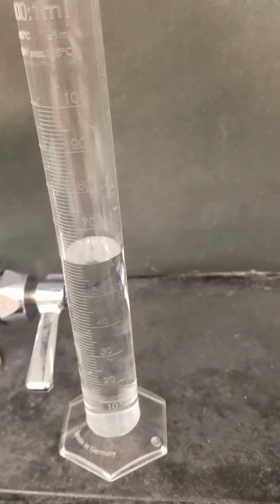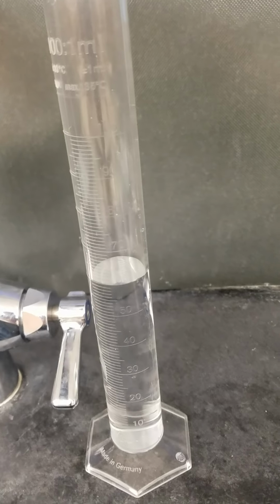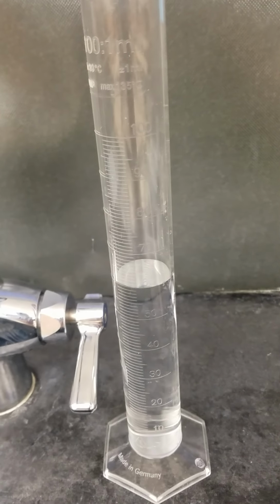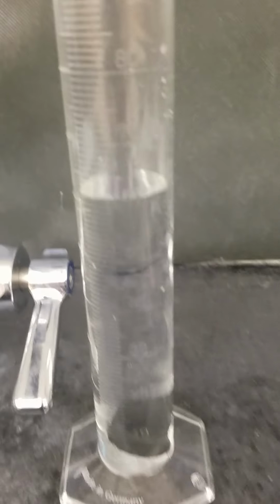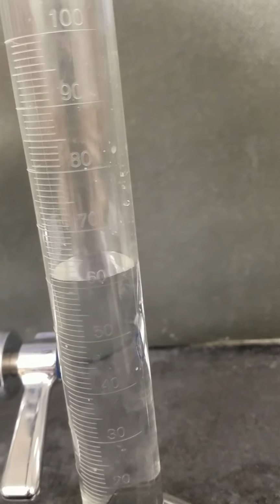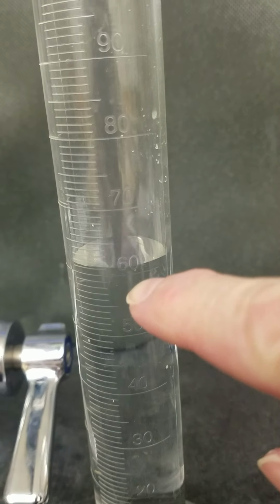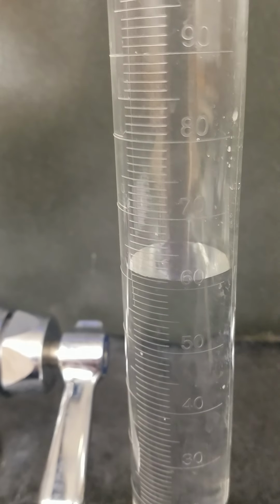Okay, and so just like when you get in the bathtub and the level goes up, that's what happens here. It's called water displacement. So we're going to see how much it displaces the water. I'm going to turn this so it doesn't get stuck. Okay, now the water level rose about 1 milliliter, if you look on here, which is the same as a cubic centimeter.